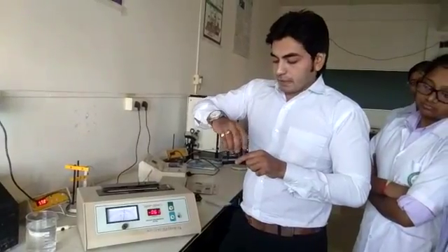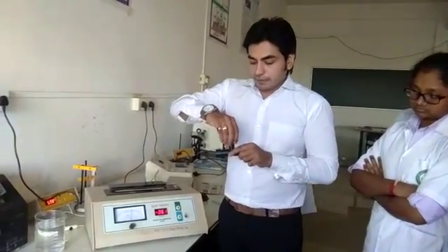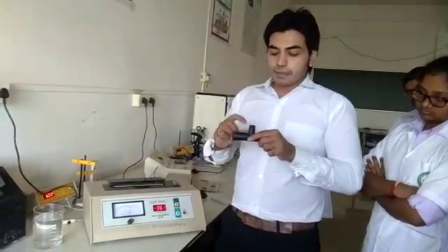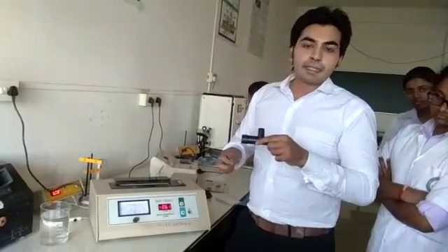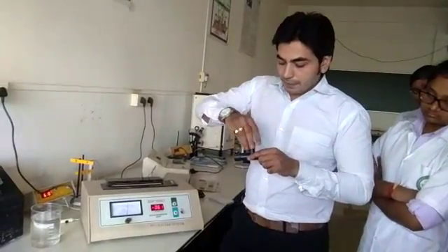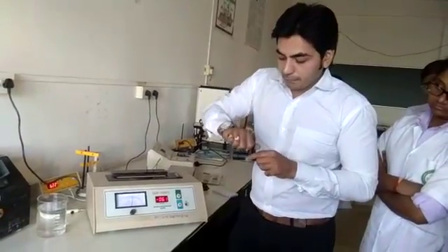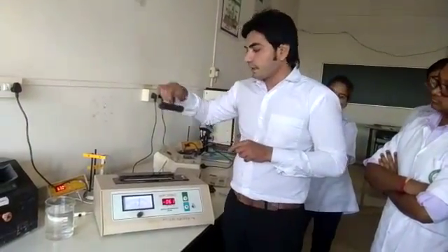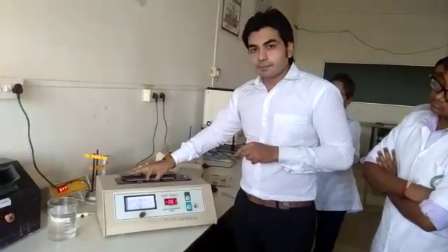There are certain conditions for the sample tube that must be fulfilled. You have to fill this tube completely up to this mark, and there should not be any air bubble inside the sample tube. After filling the sample tube with the sample you want to analyze, place the sample tube here at position P2.